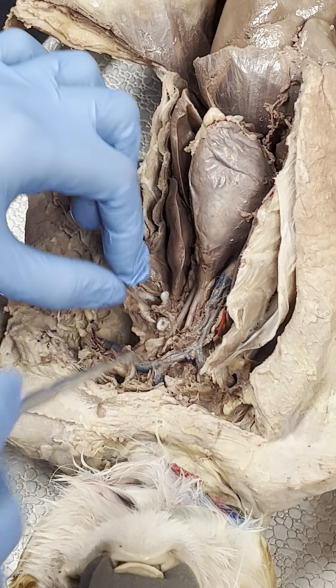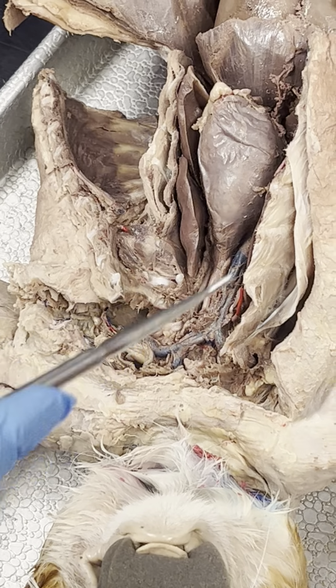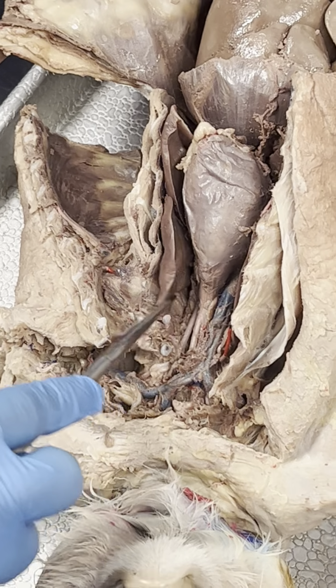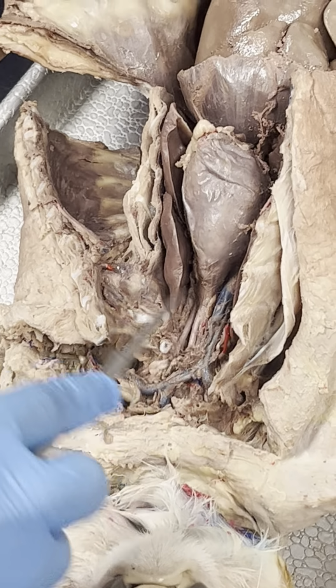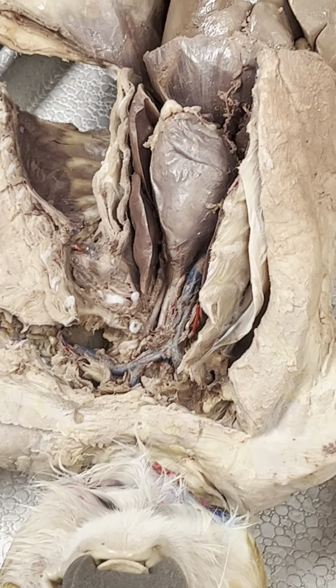Yeah, so that's the venous system. This cat has it cleared away all into the shoulder. The other cat, we haven't done that, but you can see especially this aortic branching system really well. So just make sure that you review that on that other cat.